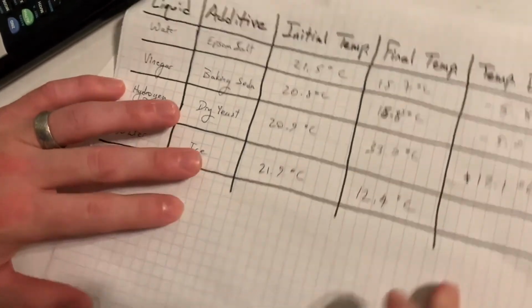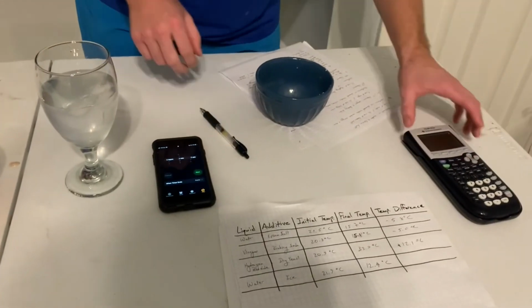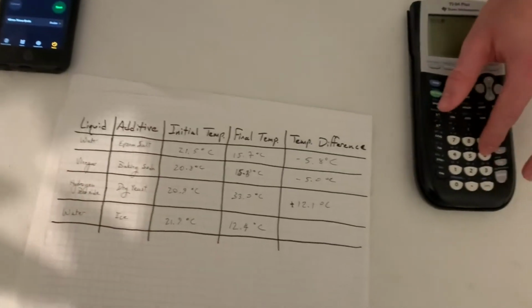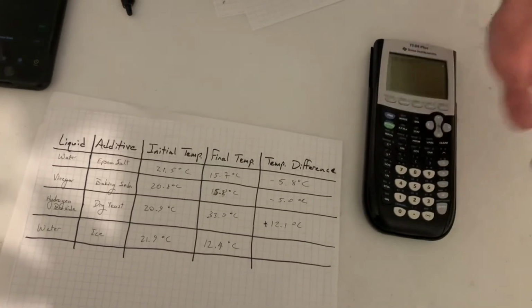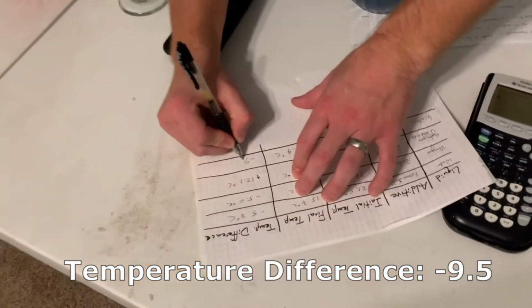12.4 degrees Celsius. Okay, so I'm going to take our calculator, and I'm going to find the temperature difference. So 12.4 degrees minus 21.9 degrees gives us a difference of negative 9.5 degrees Celsius. Wow. So what that means is that, and probably no surprise, our water got colder. But why exactly did it get colder?